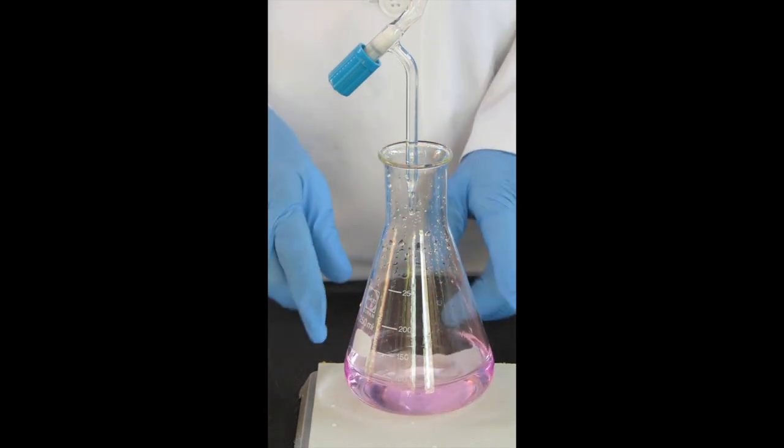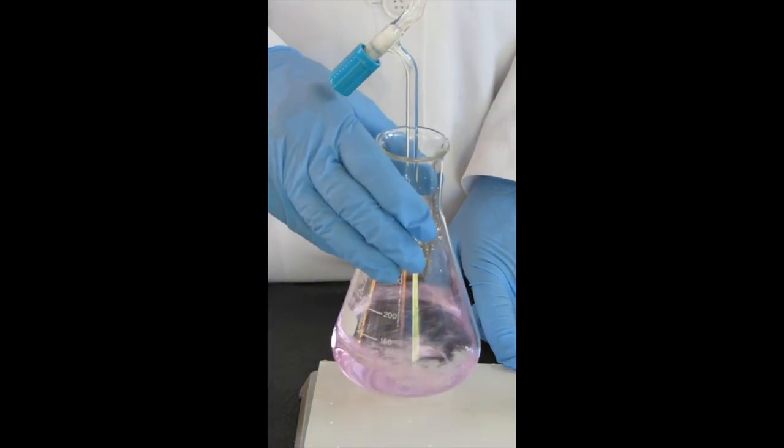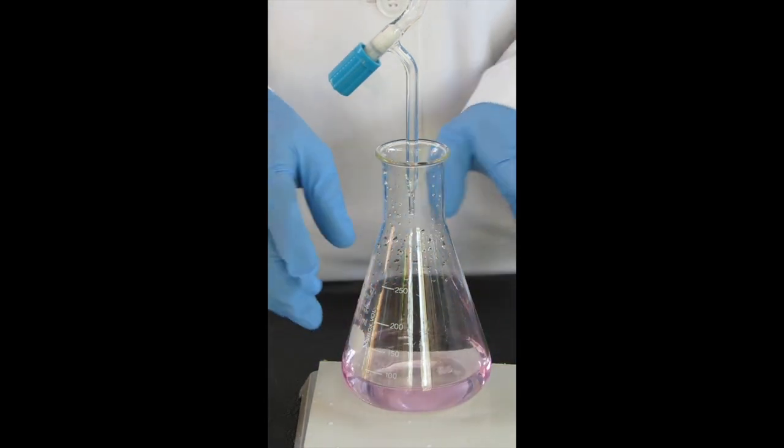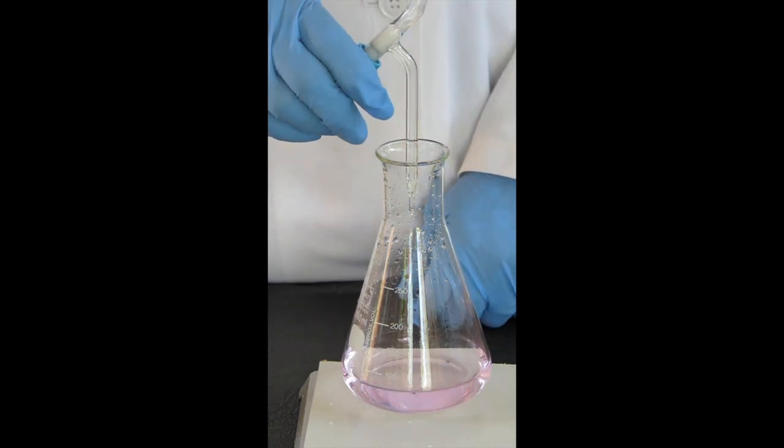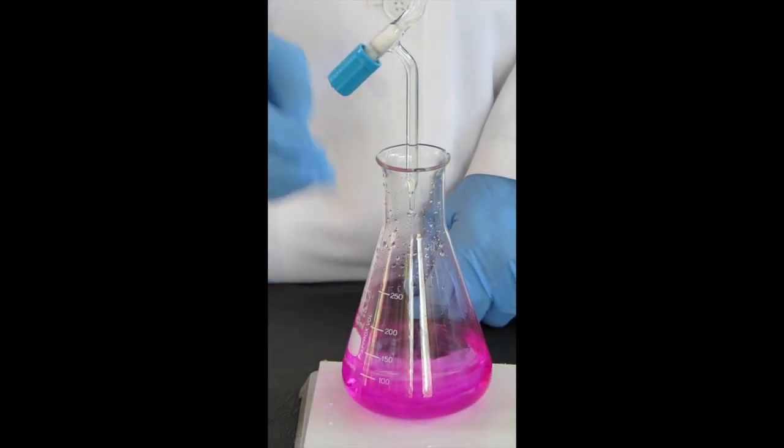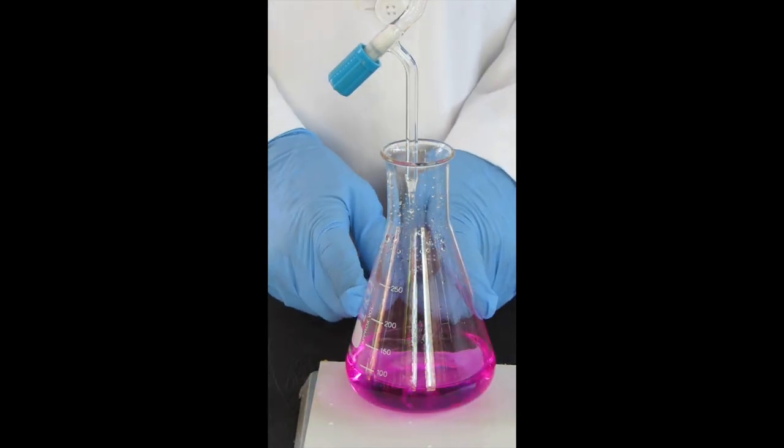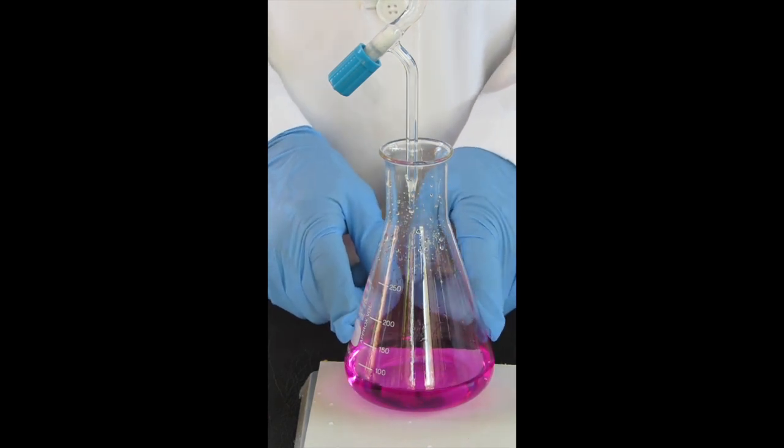This pink is persisting very nicely, but probably a little bit too long—so you're probably past your endpoint. If you continue to add base, this is what happens: you get to that dark color and you've gone way past the endpoint. Your results will not be accurate.